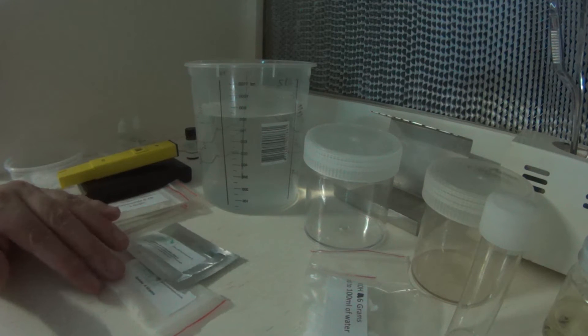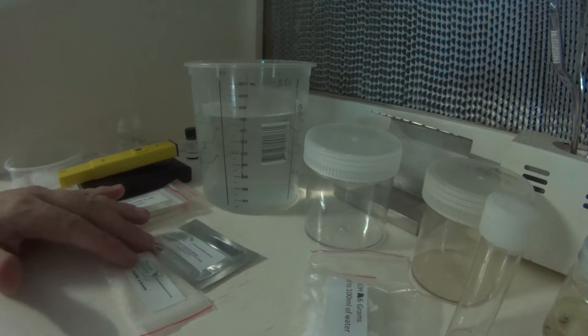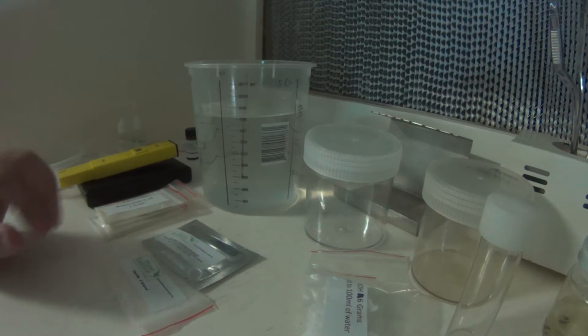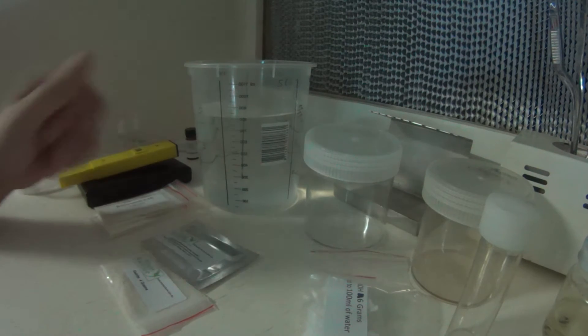I'm just going to go through preparing some media using our tissue culture kit. The kit pretty much has everything you need to culture plants, apart from a few plastic containers and things like that, and the distilled water.